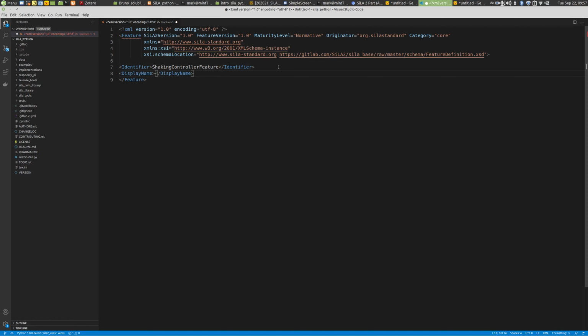So what is then the next tag? A display name is required. This display name is a human readable name, so you could use something similar but with spaces. It's nicer to read. And then you should also specify a description.